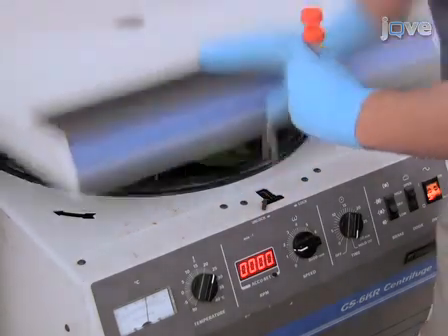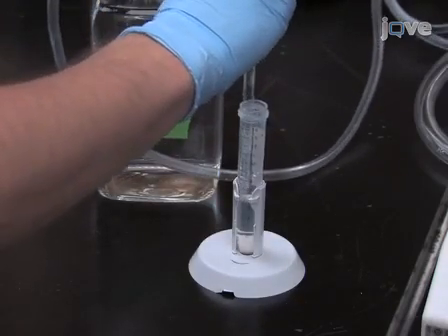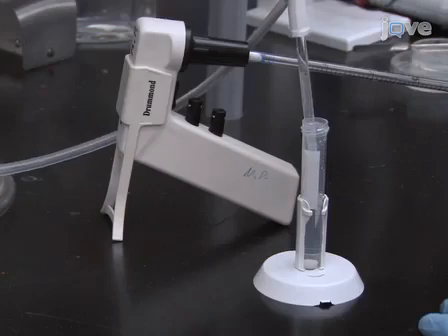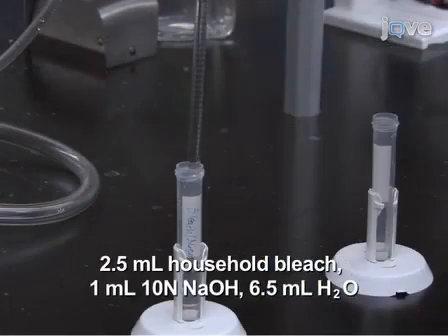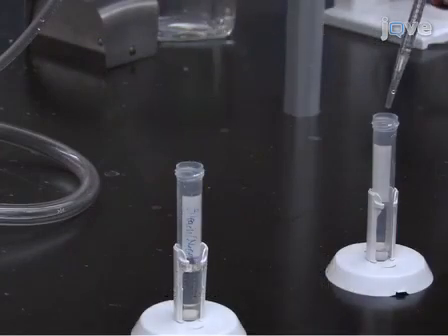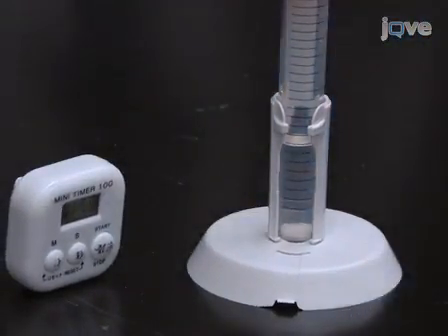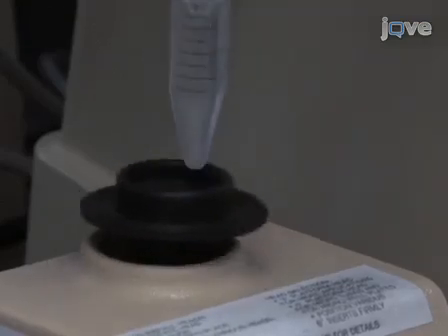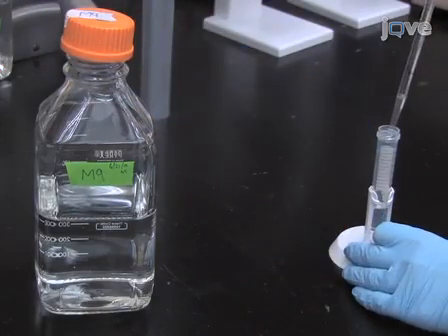Discard the supernatant and add 10 ml of water. Repeat the wash step. Remove the supernatant and add 5 ml of freshly prepared bleach sodium hydroxide solution. Incubate for 5 minutes at RT until the worms break open. Be sure to vortex gently every minute. Monitor the progress of the reaction under the dissecting microscope. As soon as all the adults dissolve, add 5 ml of M9 buffer to neutralize the reaction.